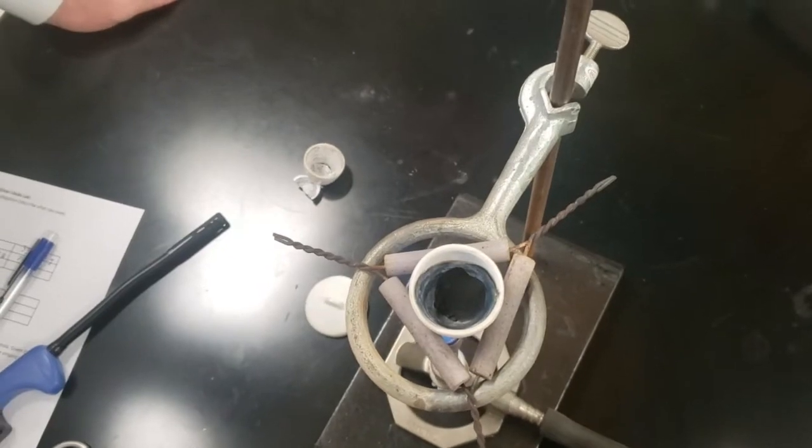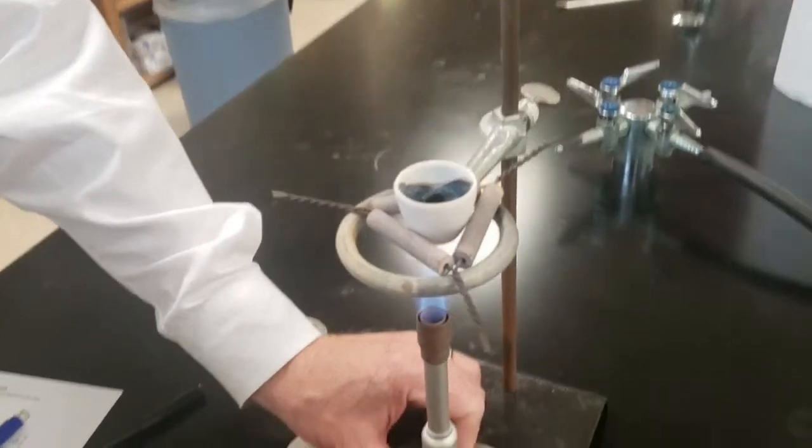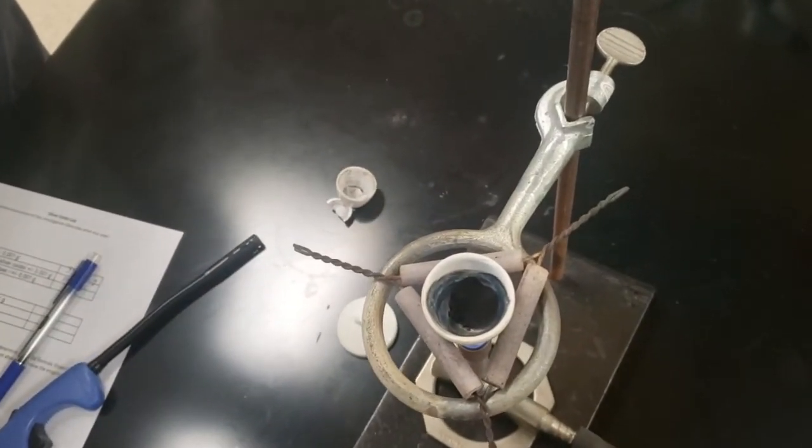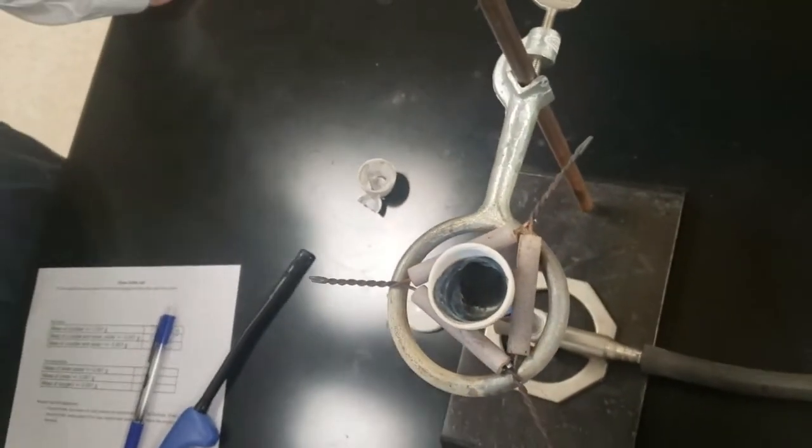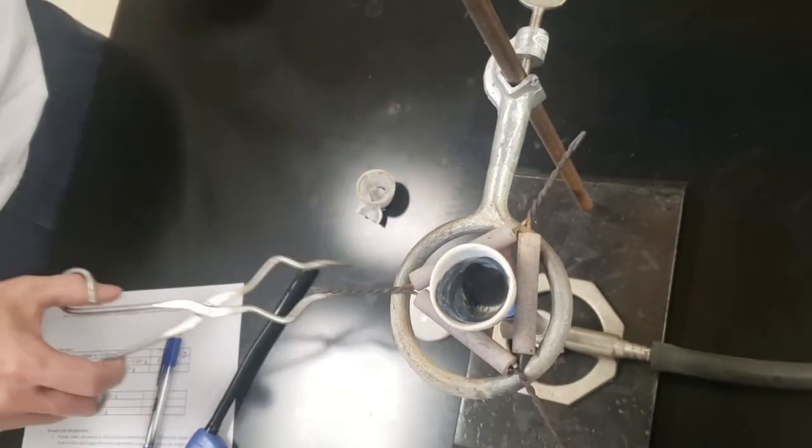Now that we've heated it up a little bit, we're going to kind of heat it up a little more. So we got the burner going right underneath it. Part of the post lab will be to write down what you see happening, so you should make observations from an angle.